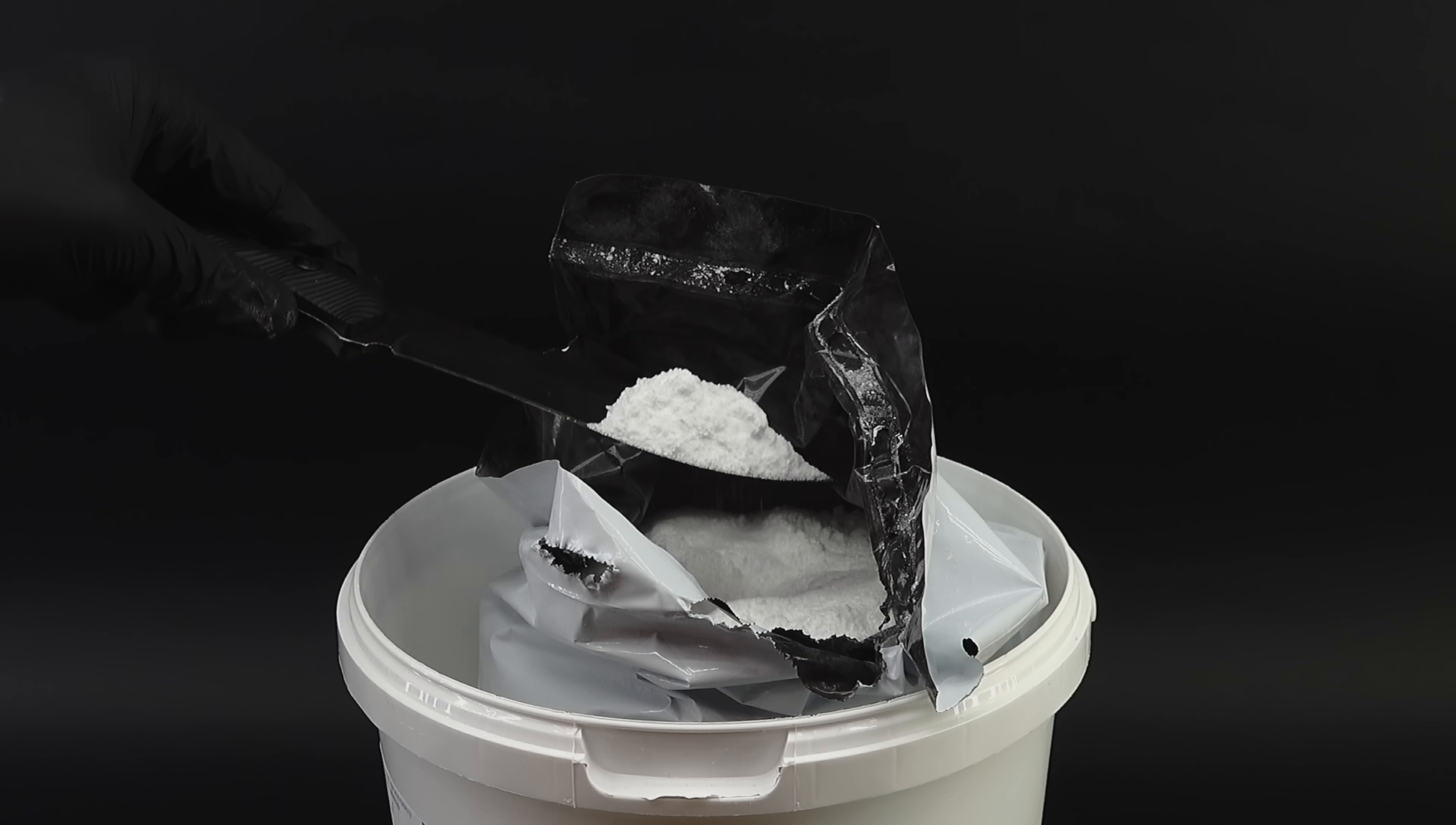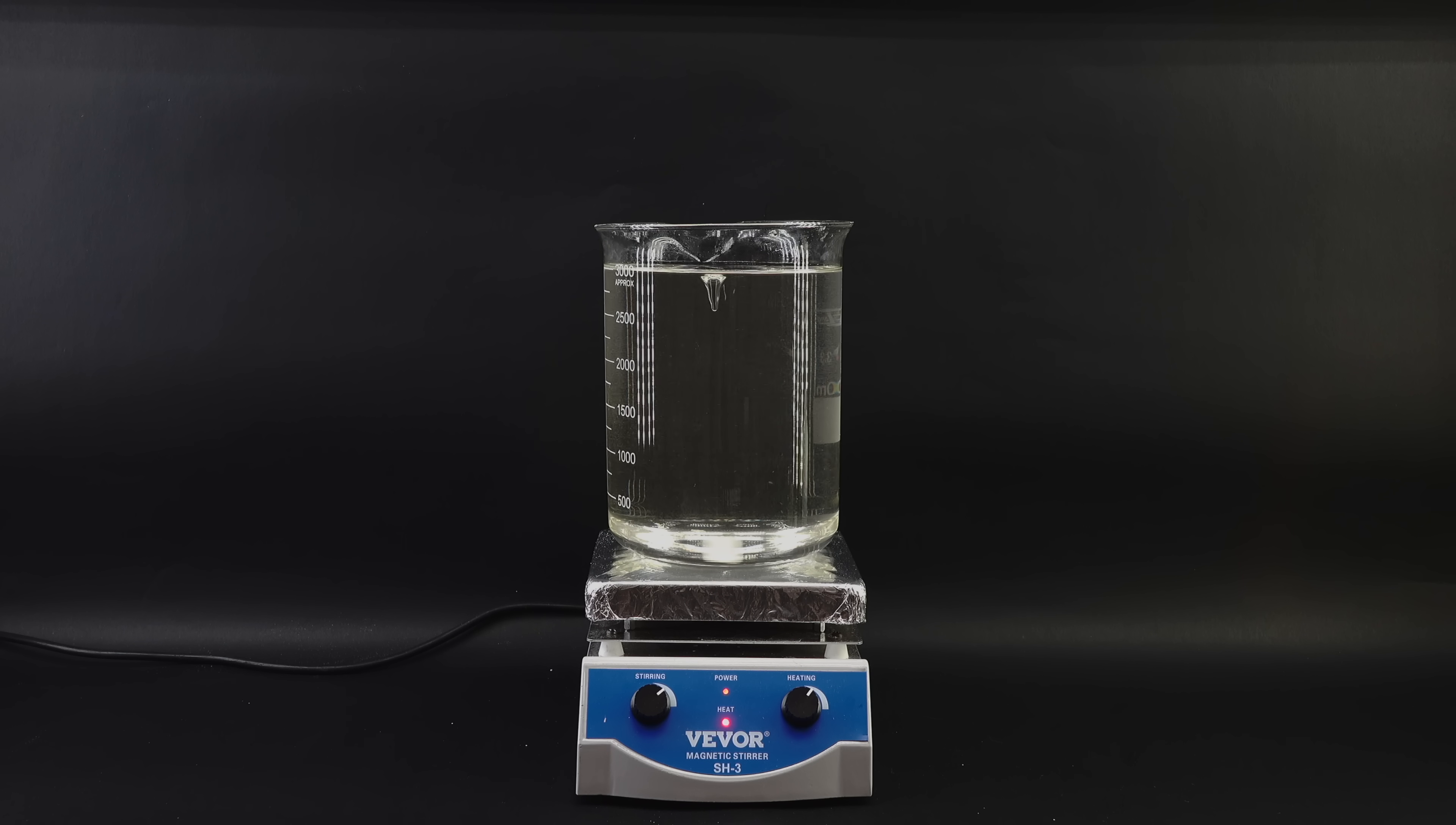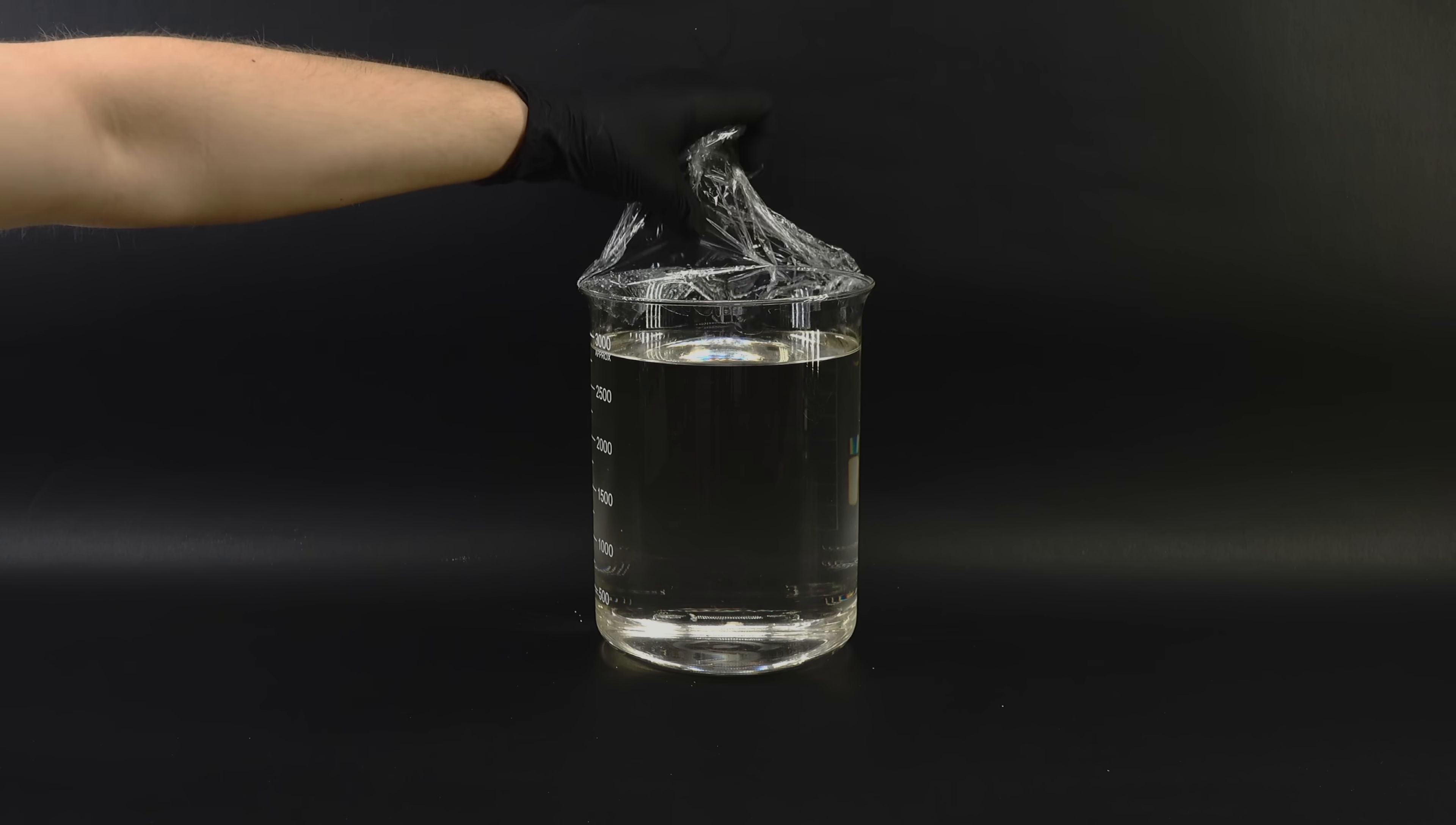To show the chemical magic contained in this thing, I got a bunch of hot distilled water into a beaker and chucked in a good bit of my sodium acetate. It quickly dissolved, forming this clear solution, and if this were just some regular boring salt, it would quickly precipitate out upon cooling. However, sodium acetate isn't your average salt, and can stay as a liquid even at room temperature.